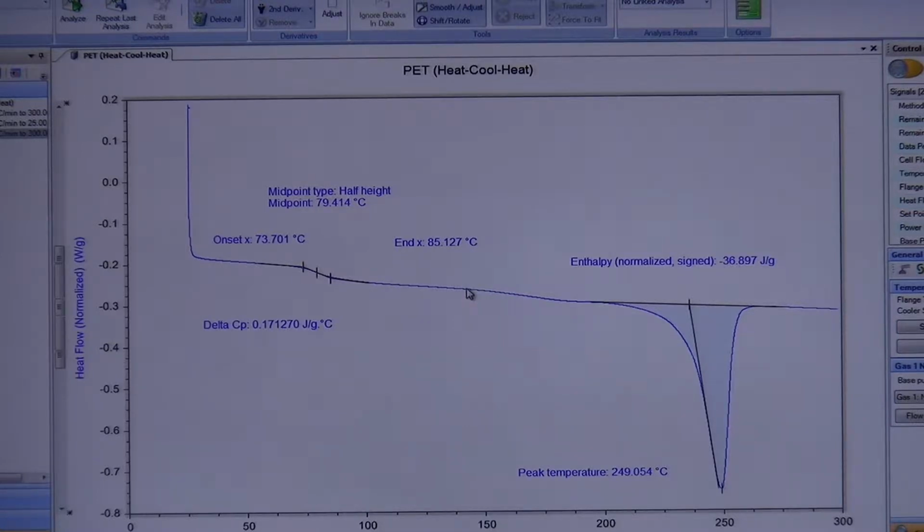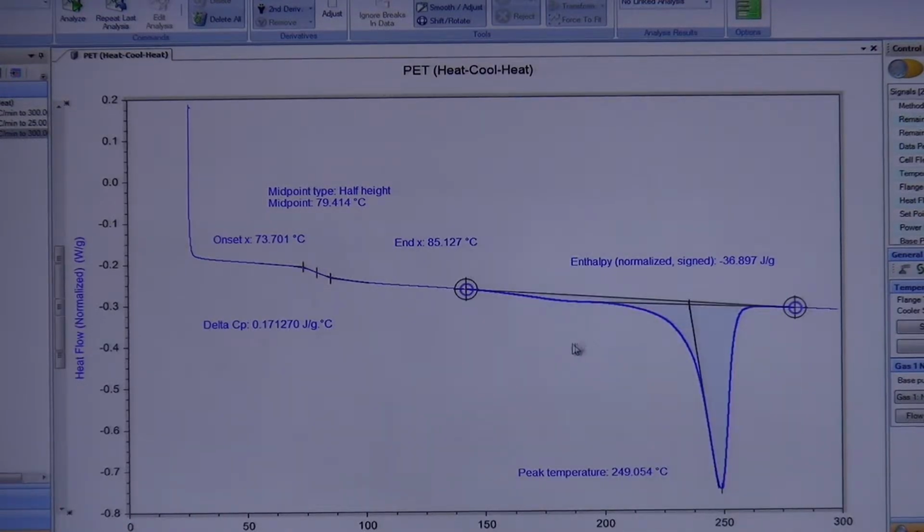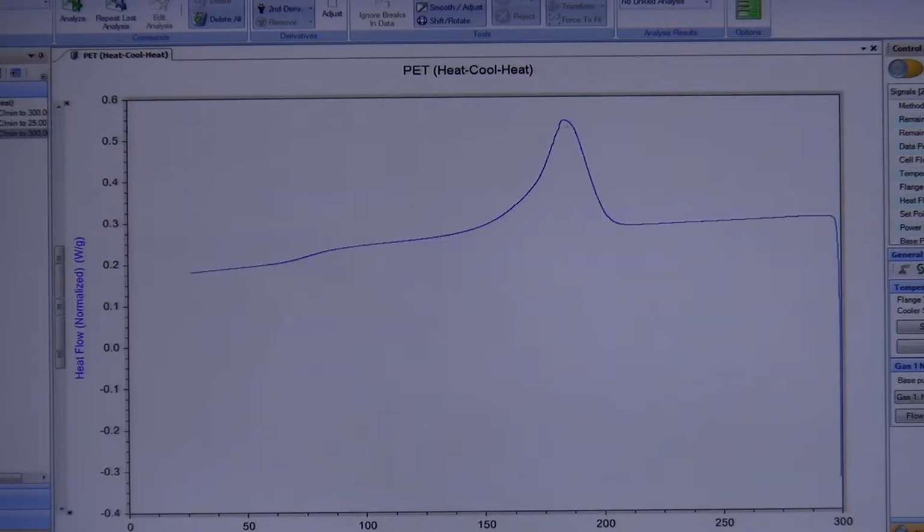So if I were to measure this entire thing as my melting, look at what happens. Now I go from an enthalpy of 37 to an enthalpy of 43. Okay? And it's just this little sliver of extra area that accounted for that. Okay? Now this is not a small change, clearly. What this is down here, because we did all this crystallization up here, okay?